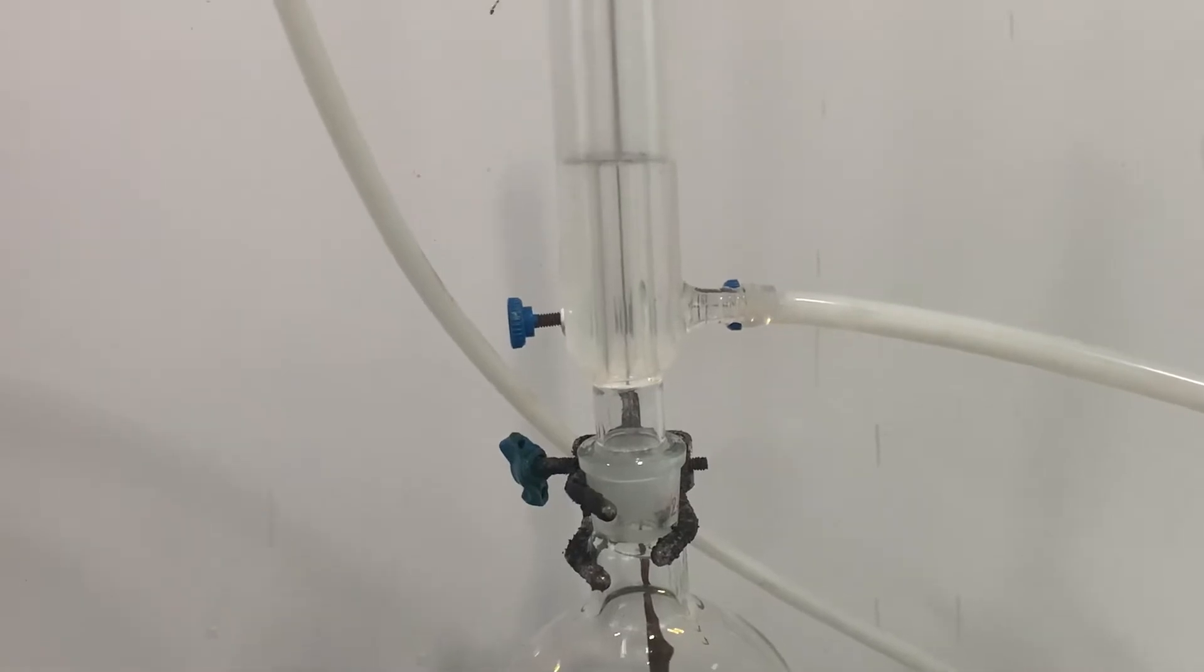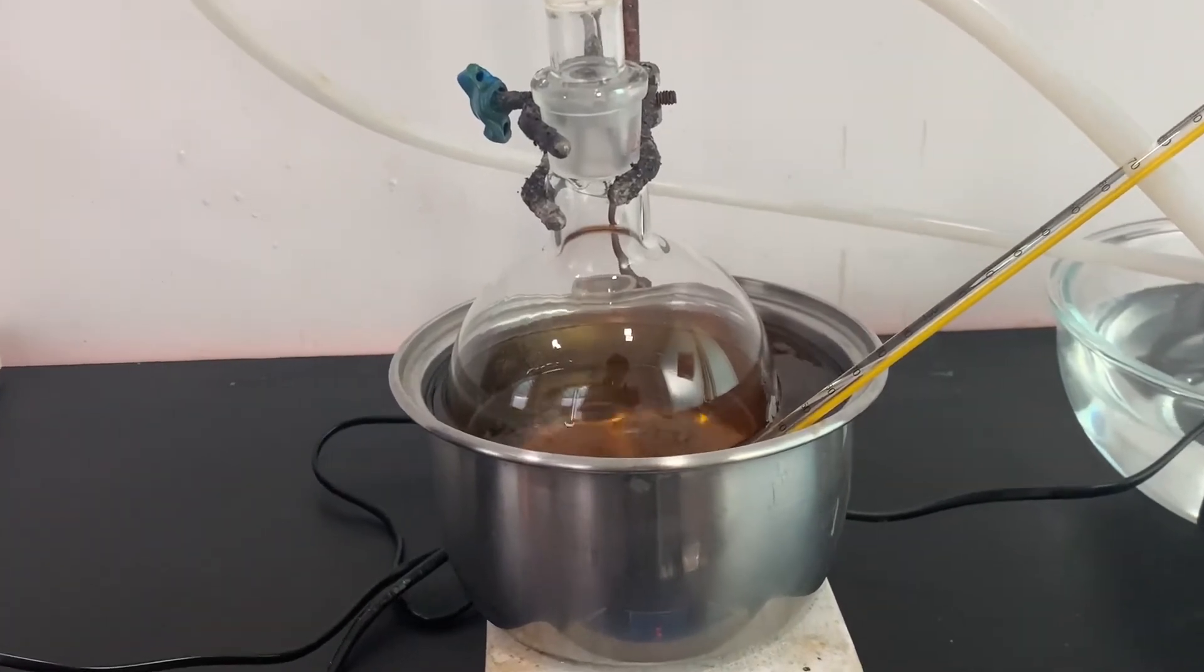I attached a condenser to the flask to set it up for reflux. It is then refluxed for 2 hours.